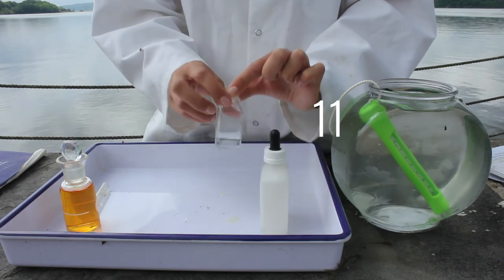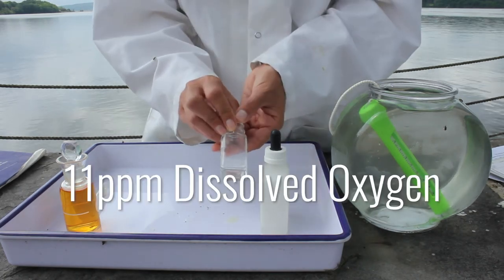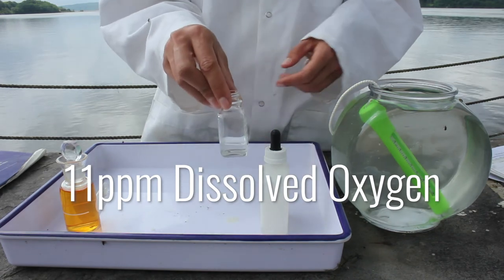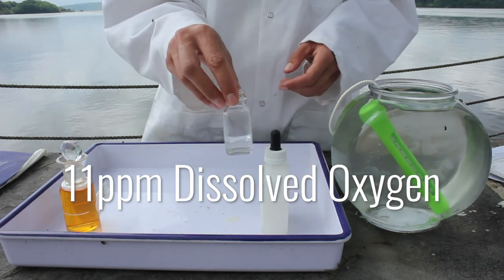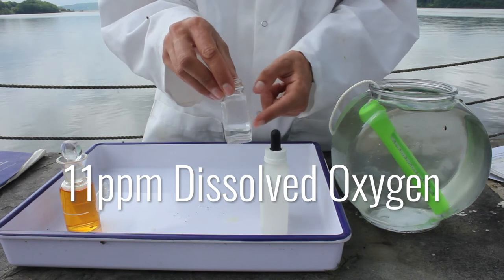Alright, so what we found today, by using this chemical process, is that we have 11 parts per million dissolved oxygen in Hudson River H₂O.